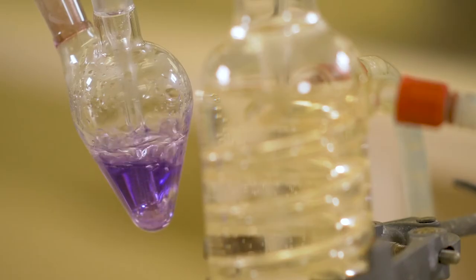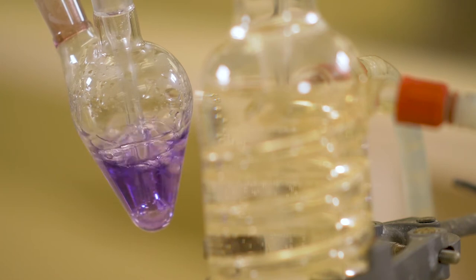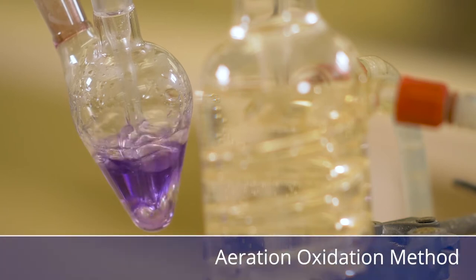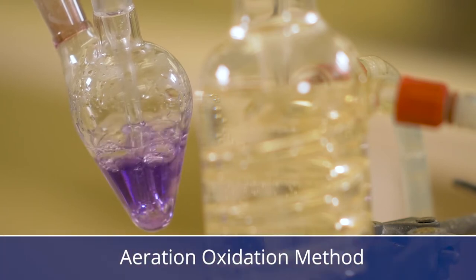While there are a number of methods available to measure sulfur dioxide, this video demonstrates a version of the aeration oxidation method, which is generally considered the reference method around the world.